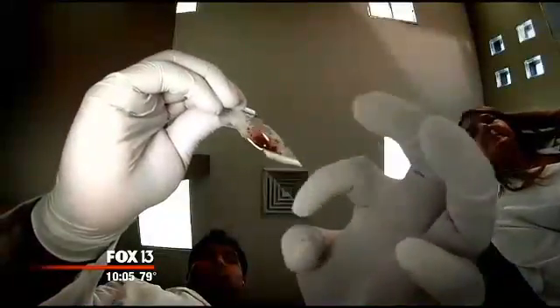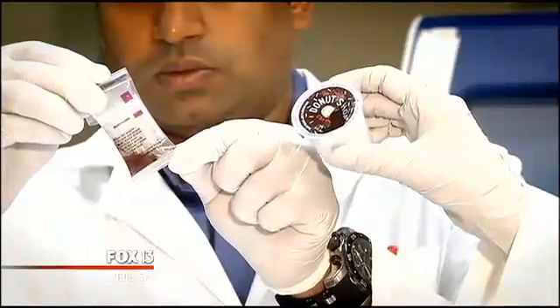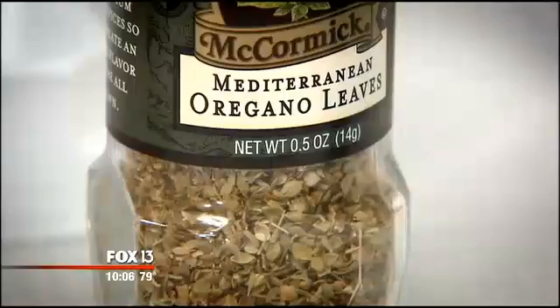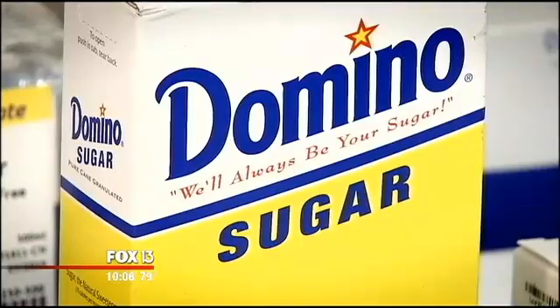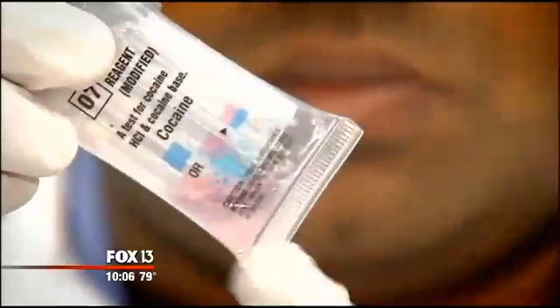Coffee. Watch what happens to coffee in a NARC 2 test pouch. We're seeing what is shown here on the pouch, a pink color, suggesting that this material could contain marijuana. But again, it's coffee. So how did the NARC 2 do with aspirin? Another false positive. And now a spice most of us have in our kitchen, oregano. The color change in the Narco Pouch test kit raises a red flag. We know that this is a false positive because this is oregano. Something wasn't clear cut. We're gonna look at sugar, mixtures of pink and blue. You can see that we have trouble interpreting the test. And you can imagine that in the field, it's even more difficult.